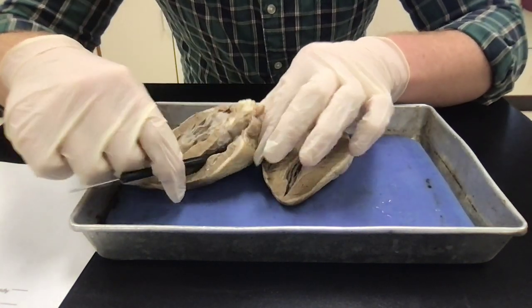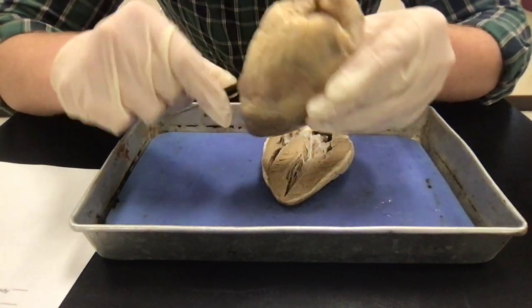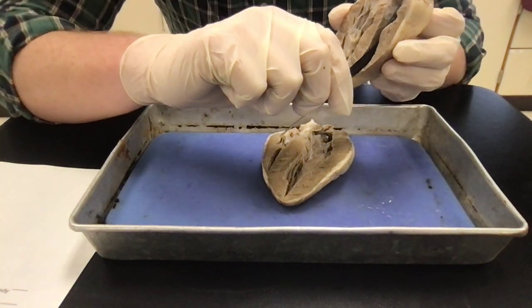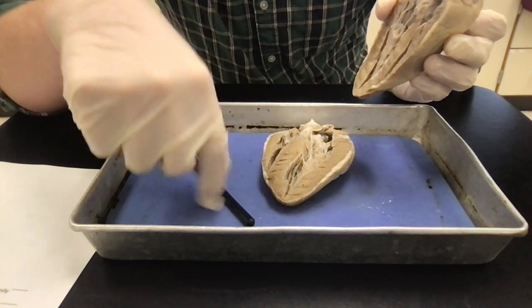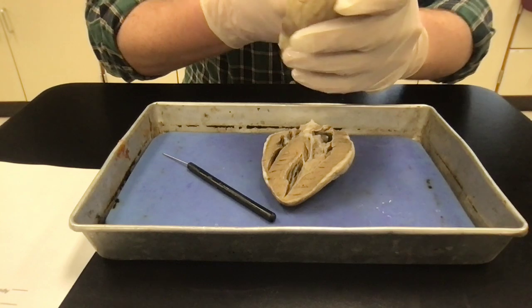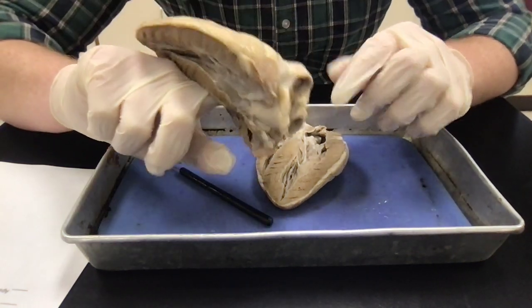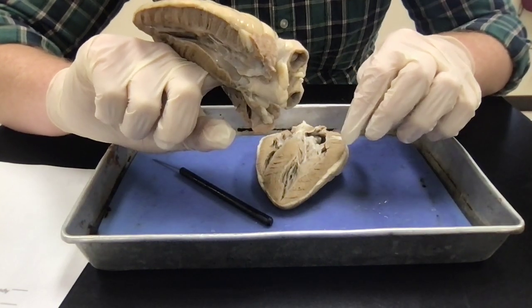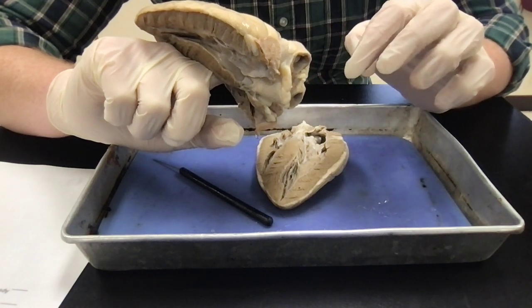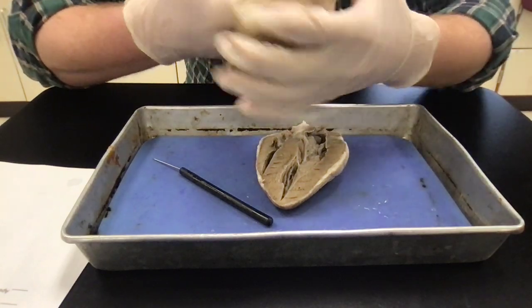And then the other one is the pulmonary artery, all right? And this is actually going to come from the right ventricle, and then it's going to go up. So it's kind of hard to do with my pointer. If I actually stick my finger up this point, you can actually see on the other side the tip of my finger, and that comes from my right ventricle to my pulmonary artery, and then from my pulmonary artery it's going to go to the lungs where the blood will become oxygenated, okay?